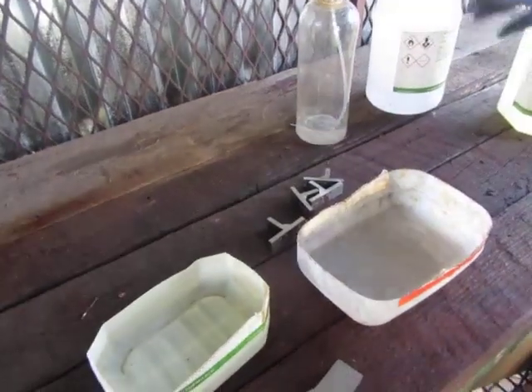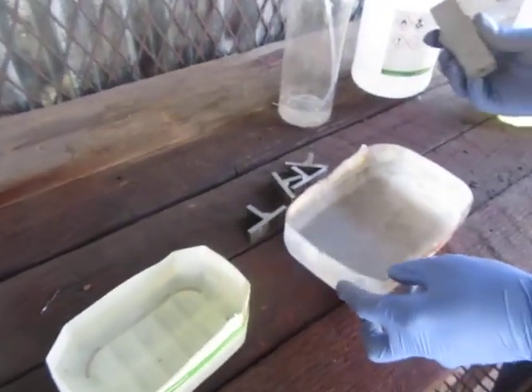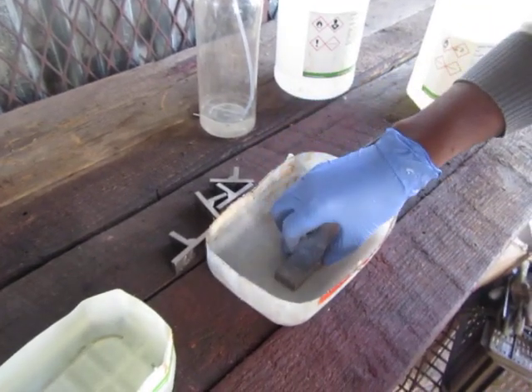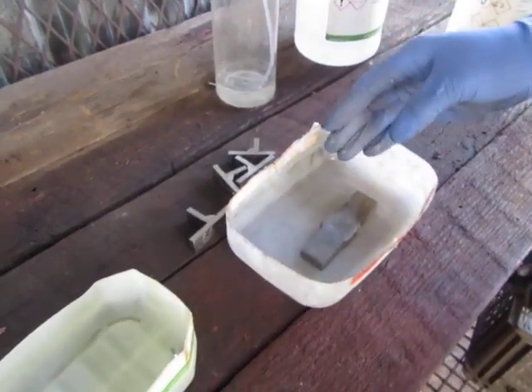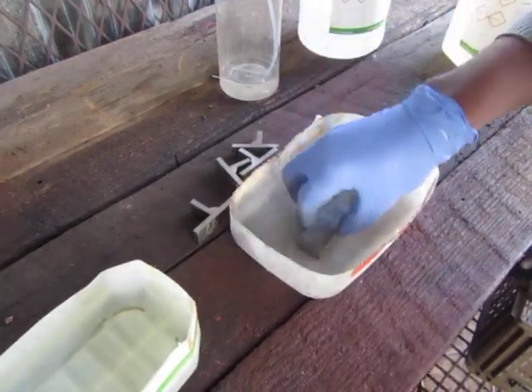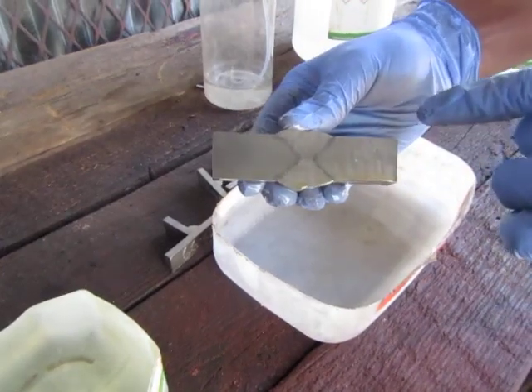Can you see how it looks? I can use it for a while if I want, but it's not necessary. If you spend something like one minute, of course the weld will be revealed. You can see now — the weld is coming out, the weld is coming out!